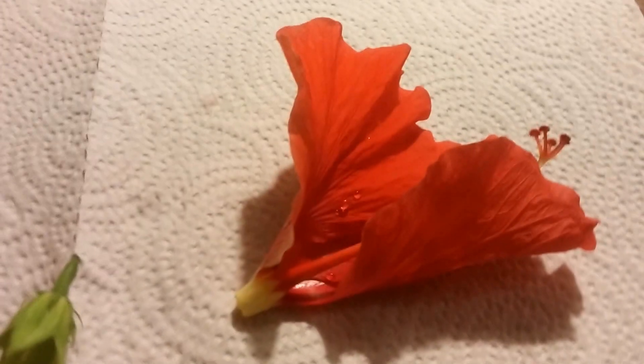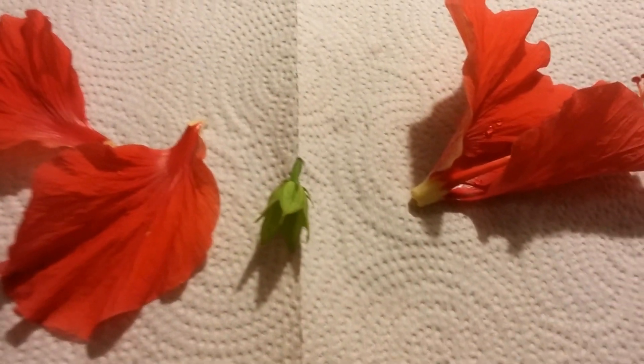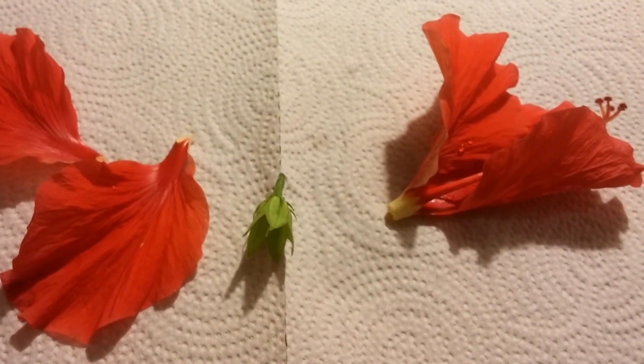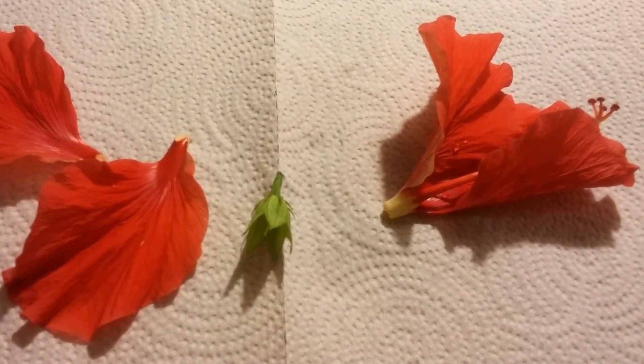So we have the sepals, we have the petals, we have the stamen which contains the anthers and the filaments. We have the carpel, which contains the stigma, the style, and the ovary. So all of these, they are the structures. Have a good day, guys.